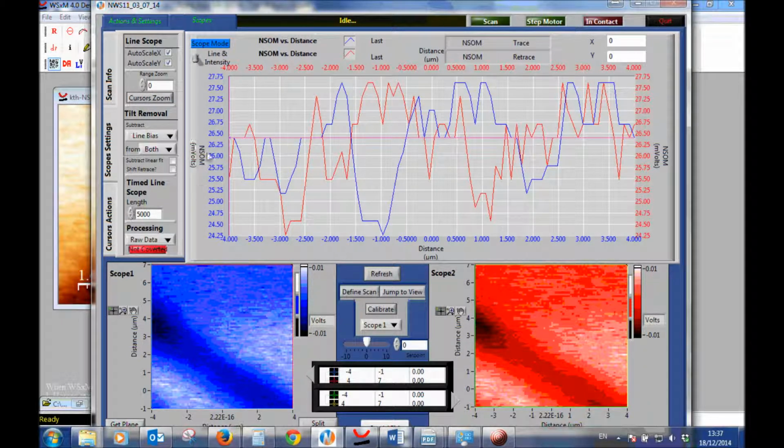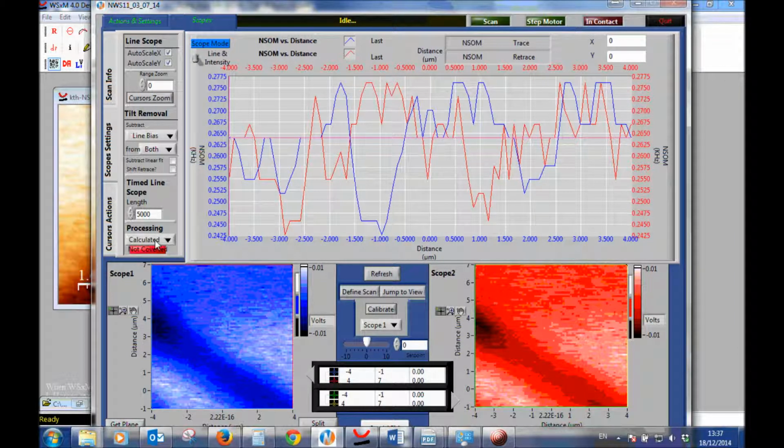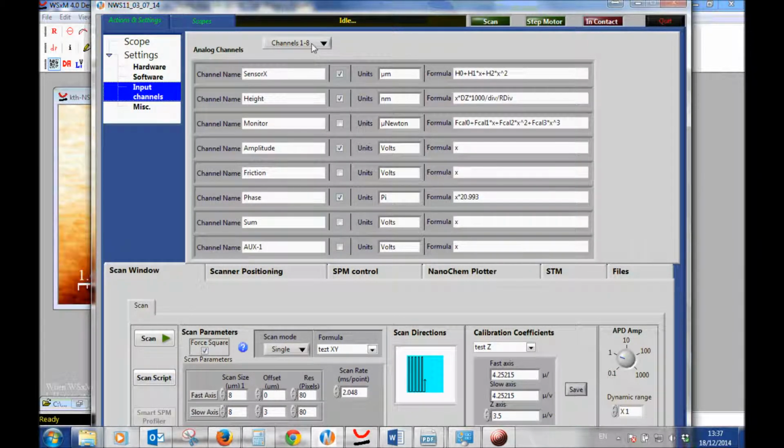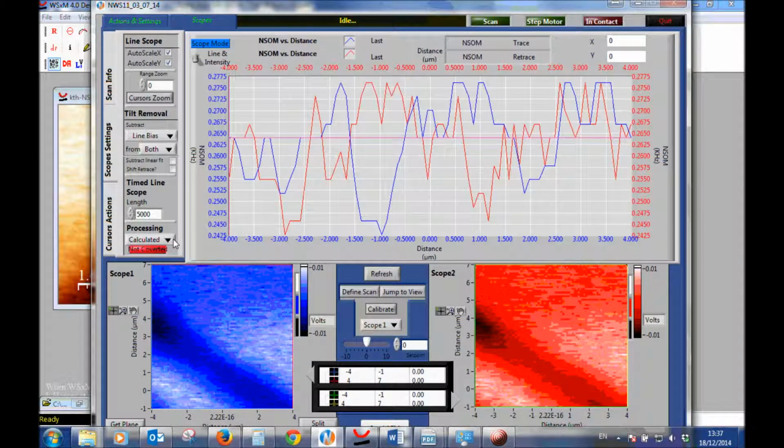The raw data is the millivolts, or the volts, going into the DT, and after they go into the DT we do some process to them. So this is the calculated. The calculated is the formula which we input in the input channels. So here, for NSOM, we have a certain formula. It takes the volts and applies a certain formula, and that's what we see in the calculated values here.